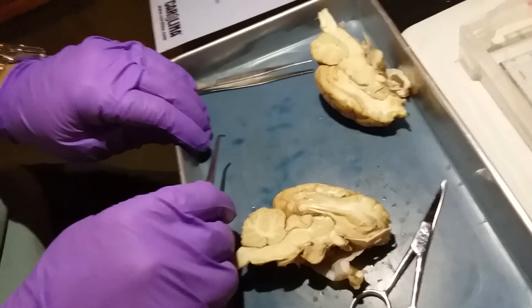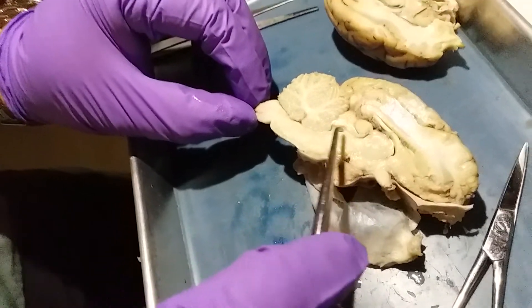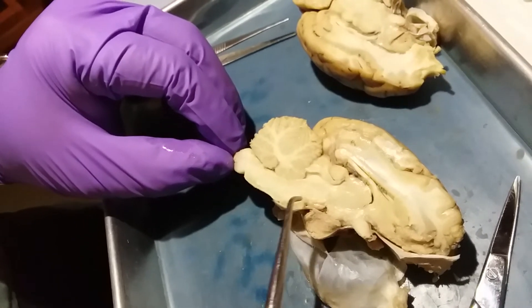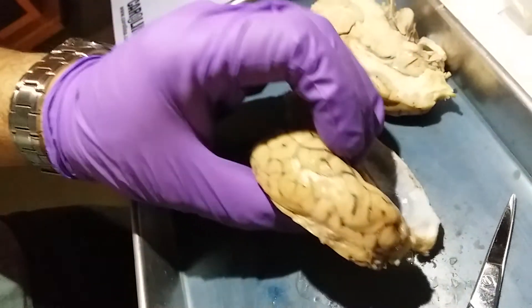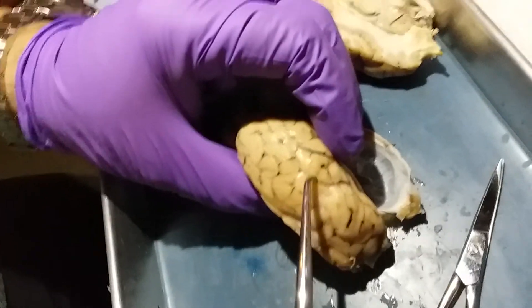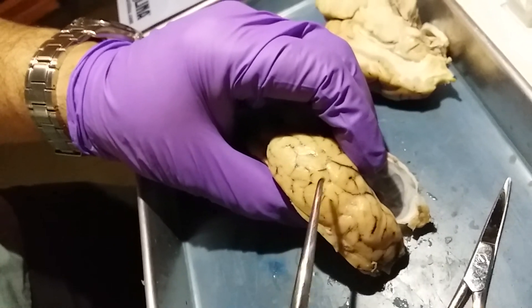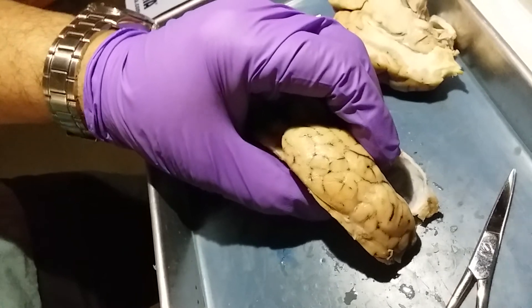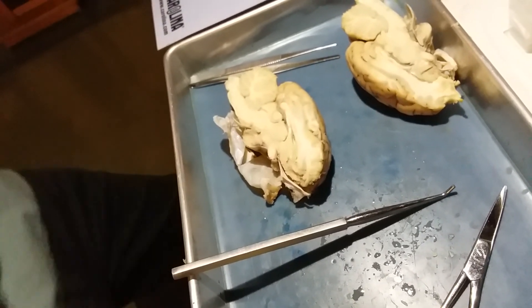The midbrain is located right here and it houses the corpora quadrigemina — the superior and inferior colliculi. Below the midbrain is the pons, and below that is the medulla. The sulci are depressions — basically grooves in the brain surface. The gyri are the folds; each fold is a gyrus. The dark parts where blood vessels are located are the sulci, covered with pia mater.